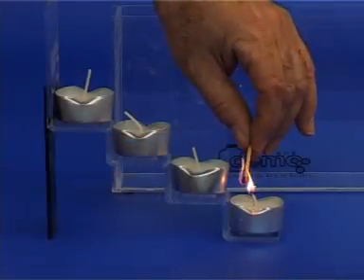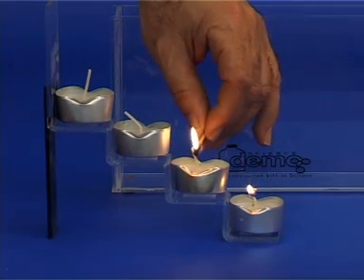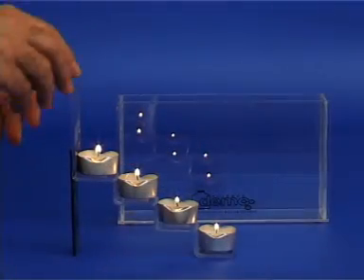Ensure that no wind is blowing while you perform the experiment. Light the candles on the steps and then place the structure into the transparent container as shown here.